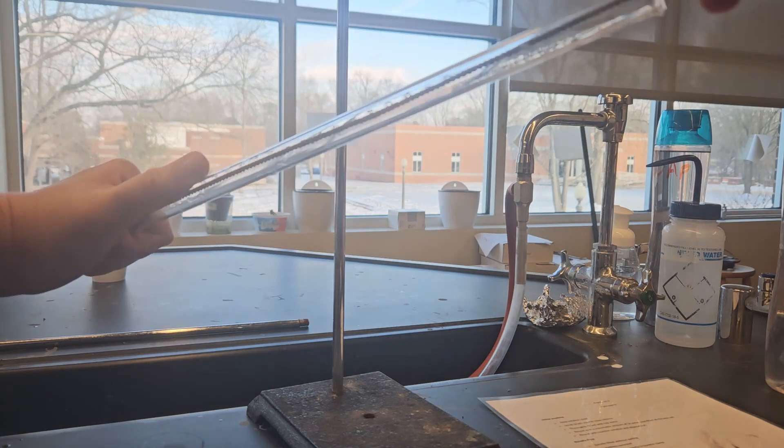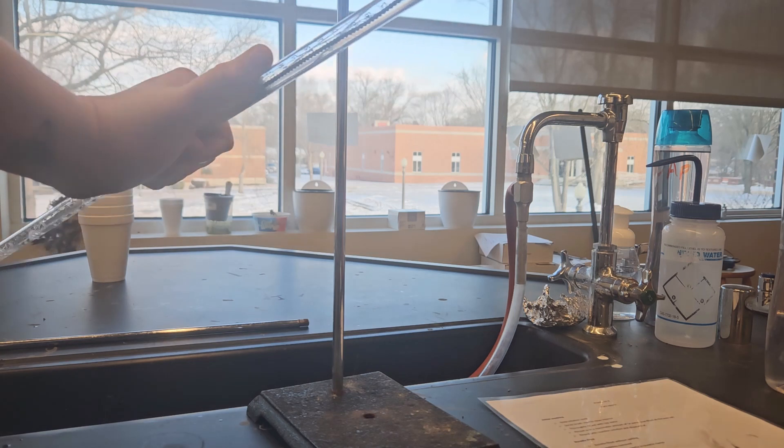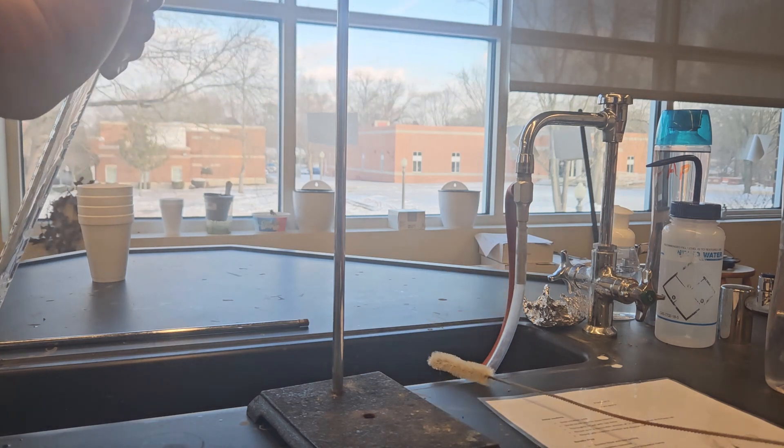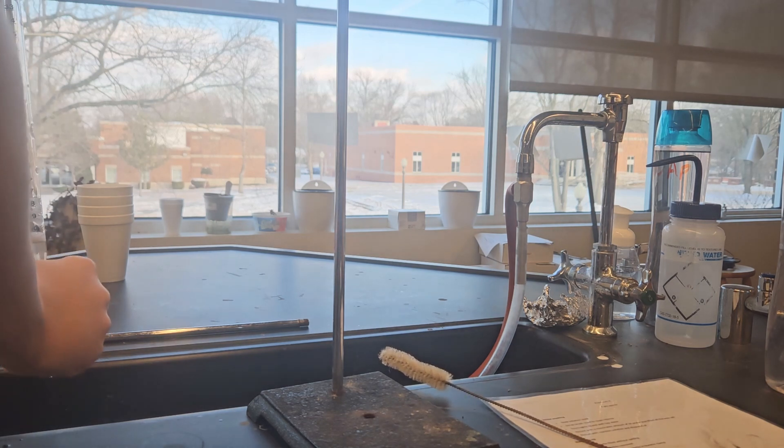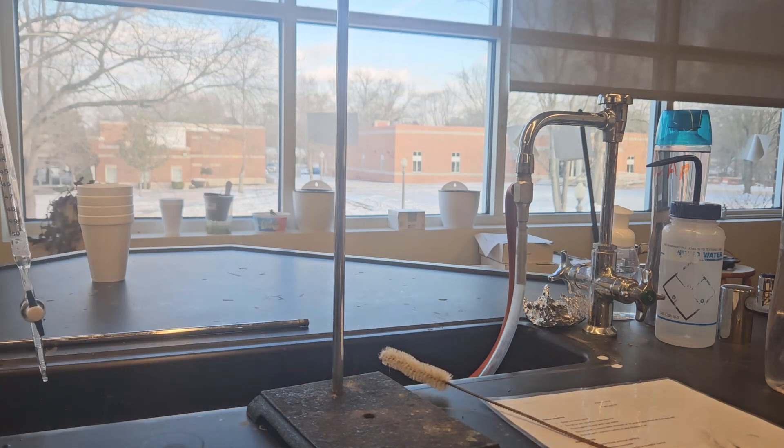I'm going to then use this long scrub brush, fit that into here and basically plunge this several times to create some nice suds. That's going to create a nice tight clean. I'm going to go ahead and let that drain out the tip.